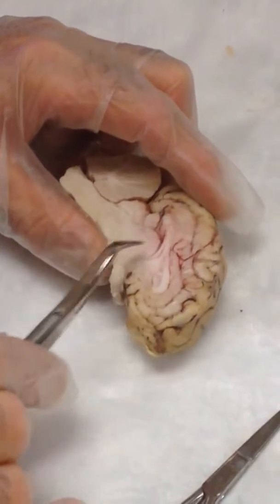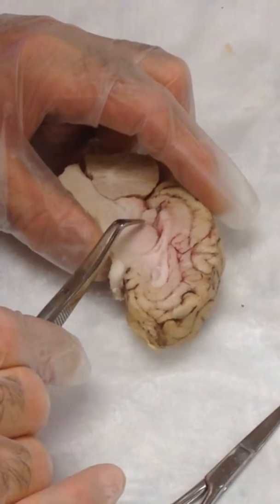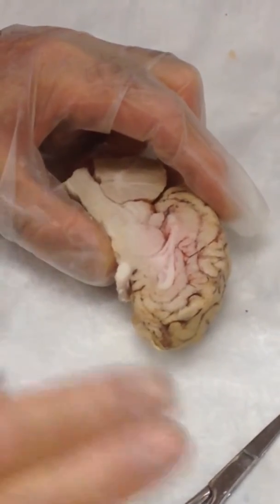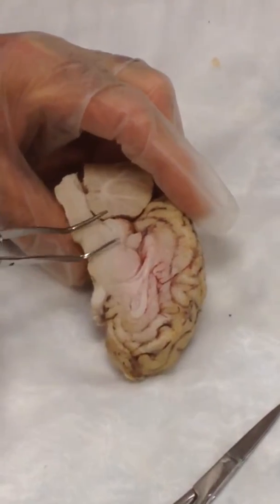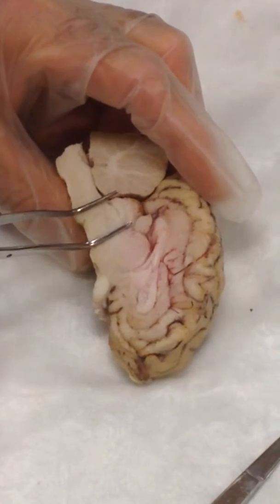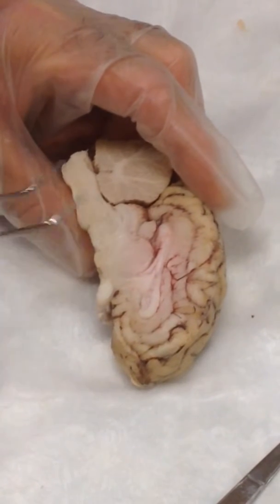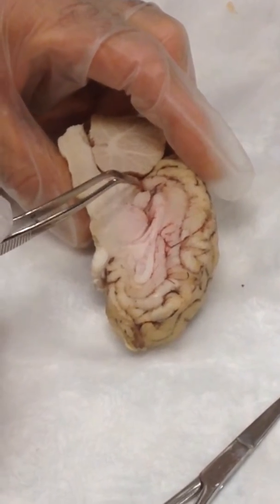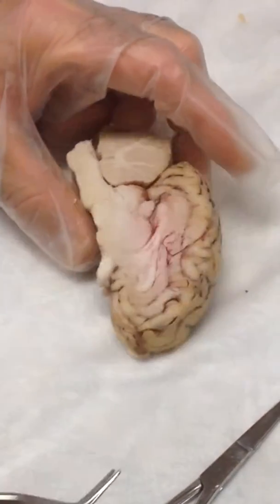If you look at the thalamus here, you notice this little goober. It's kind of like a teardrop shape here. That's the habenula. This is all on the list and it's all labeled on those things. Important on either side, so here's the aqueduct. On either side of the aqueduct, that defines the mesencephalon. So this is mesencephalon, that's mesencephalon, this is superior colliculus. That's the mesencephalon. You guys are off.